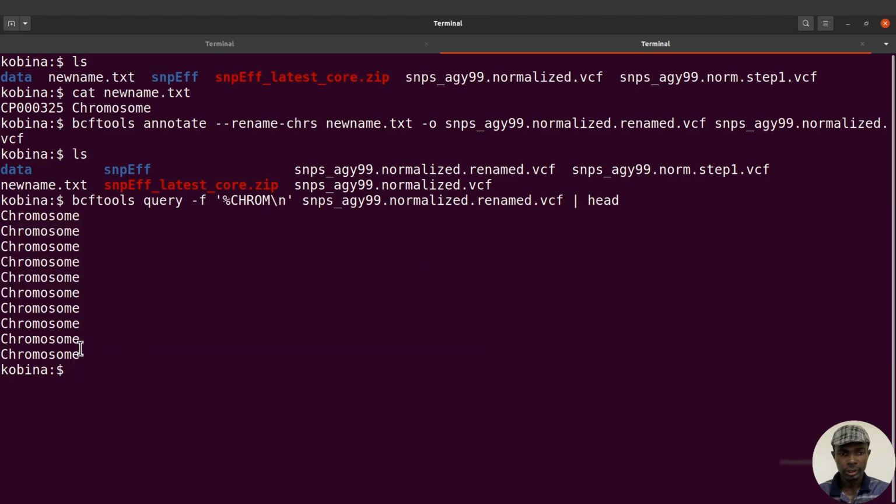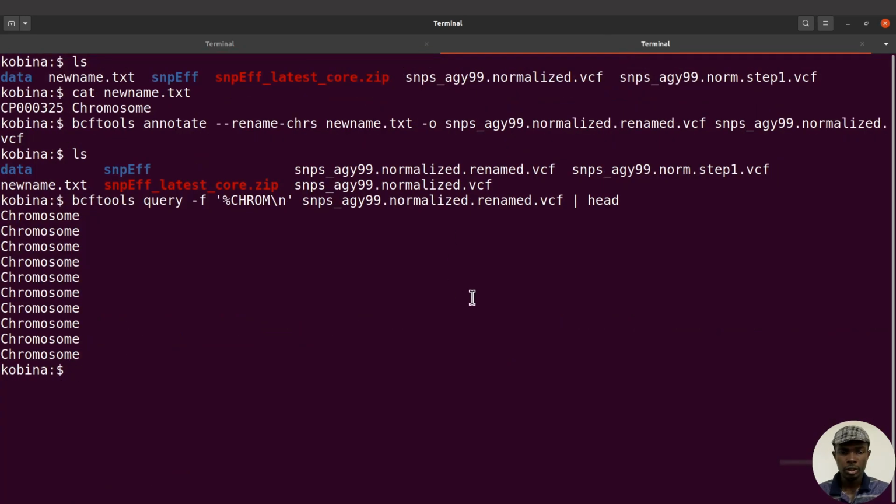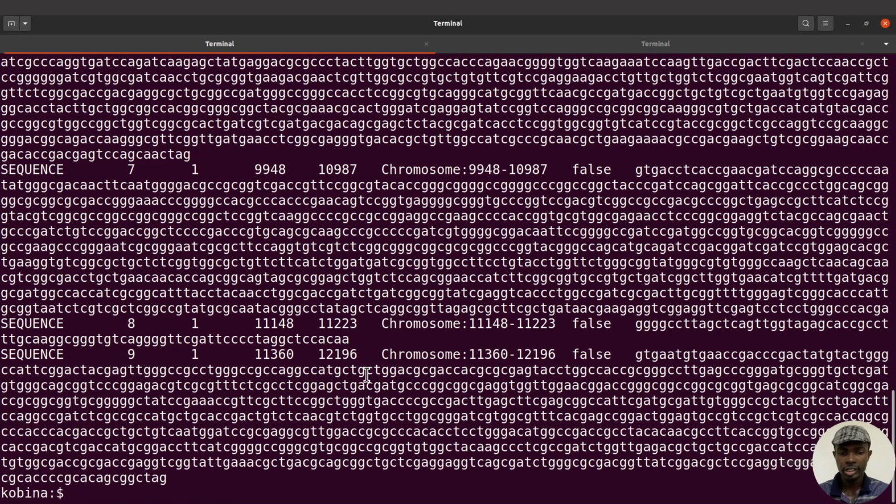Now, if let's say you don't see the word chromosome in that database, then you have to use the appropriate names, so the same format. So take note of that. All right. So now we have this one, and this one matches what is here. So now we can rerun snpeff, and then we are sure to get what we want. Okay. So this is what I want to do. I'm now going to rerun snpeff again and then get my variant effects predicted for me.